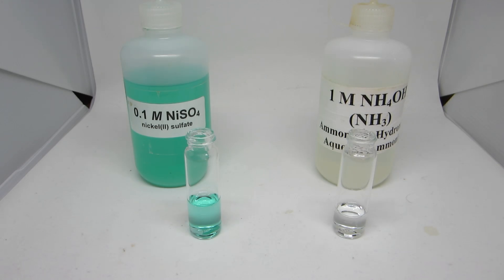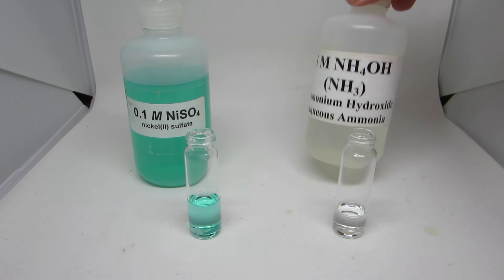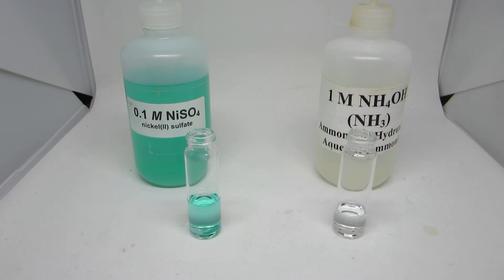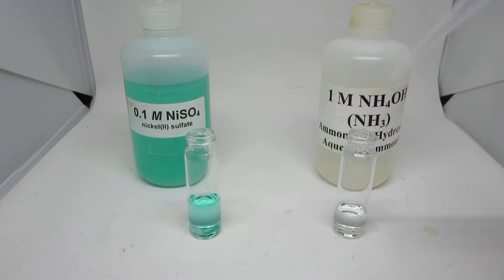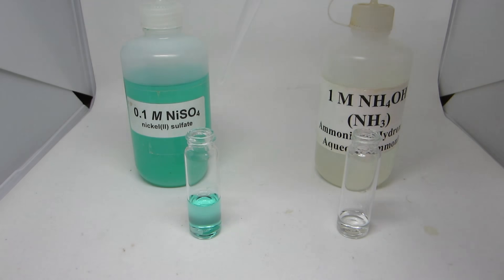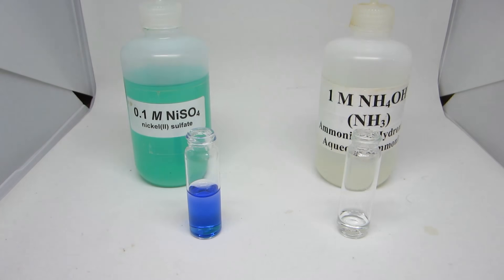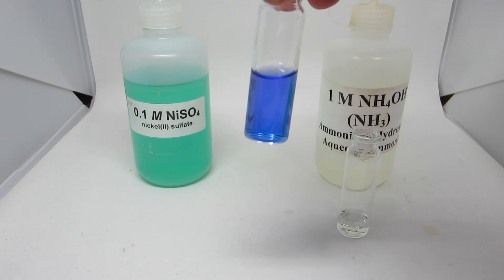In the sixth reaction, we'll be mixing clear and colorless aqueous ammonia solution, NH₃, also known as ammonium hydroxide, with the nickel sulfate solution, which is green. When mixing the solutions together, there will be a slight precipitate formation at first, upon which the solution becomes clear and is now a blue color.